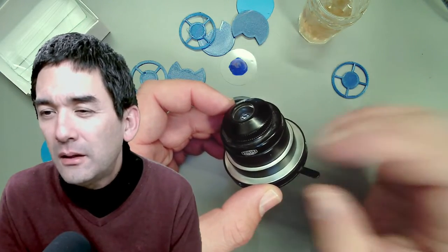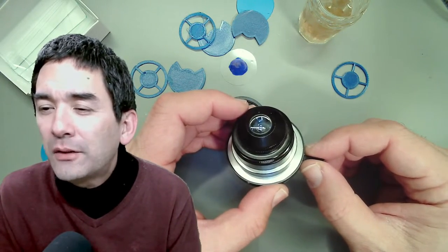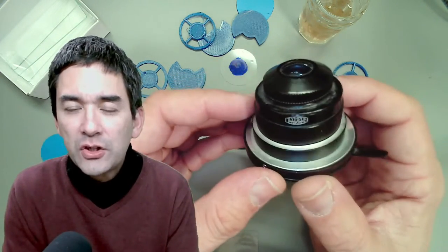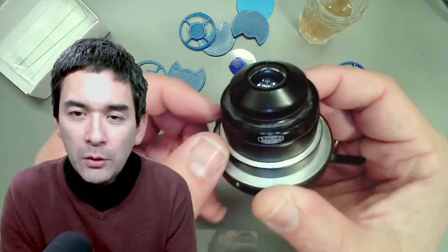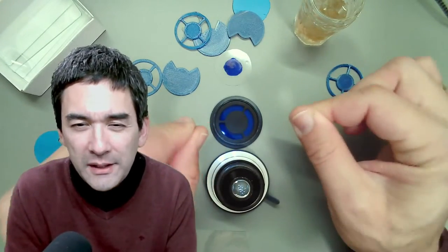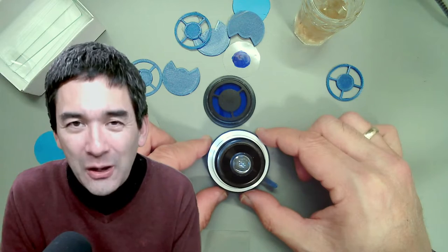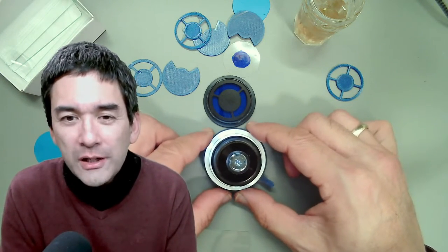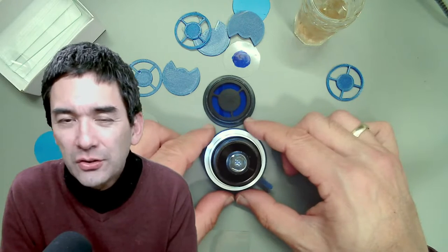How do you detach the condenser? This one had a screw which tightened it and then it simply went off. Some microscopes have two additional centering screws diagonally placed that allow you to center the condenser. Generally, once it's centered it should stay centered and there shouldn't be much need to recenter it.